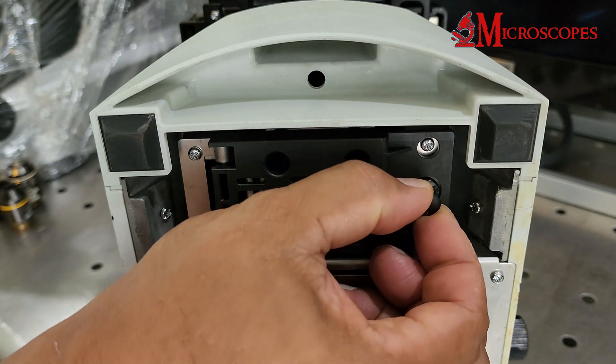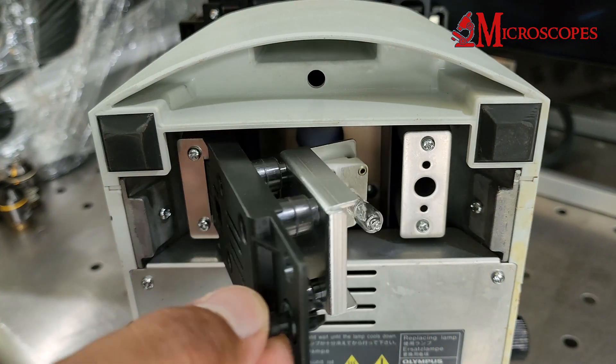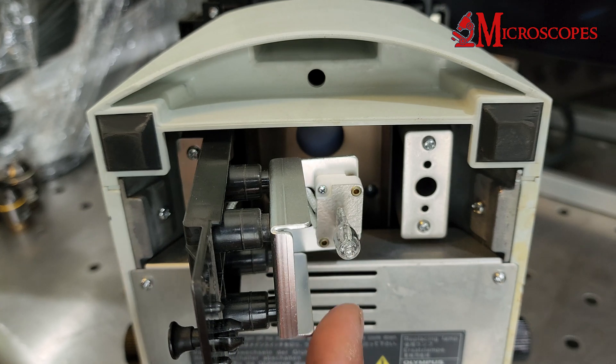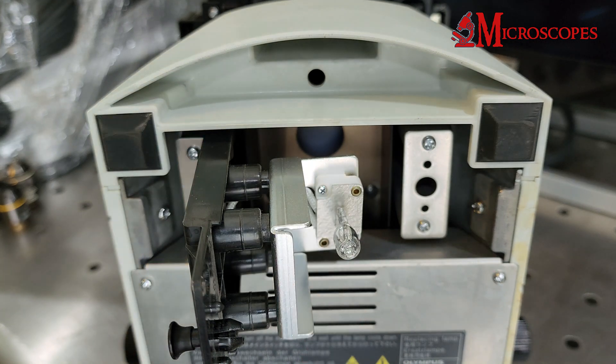The microscope body is heavy. Please be careful of falling or hitting, as it may damage other components.